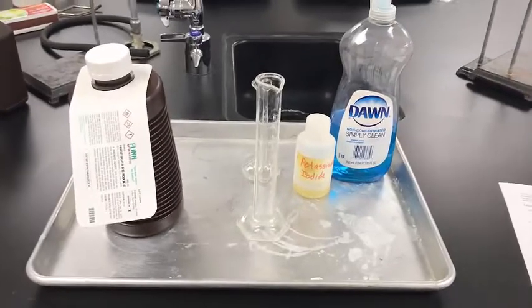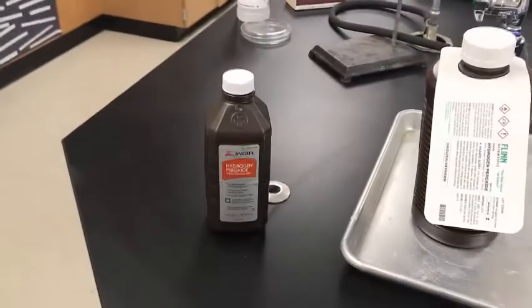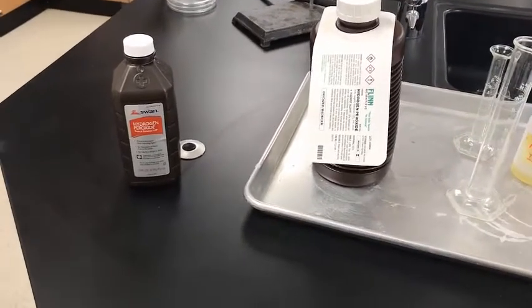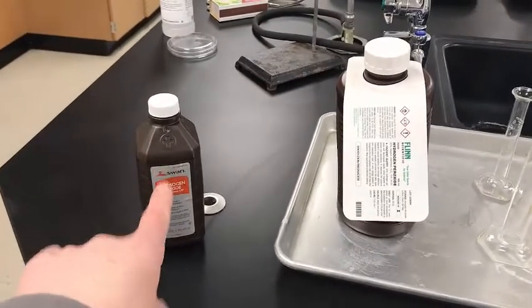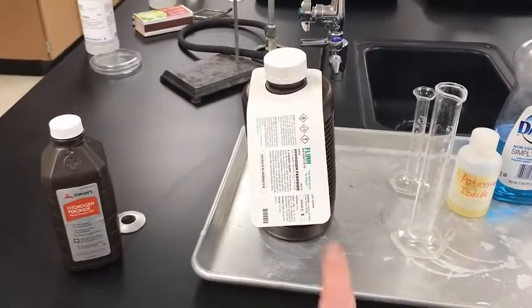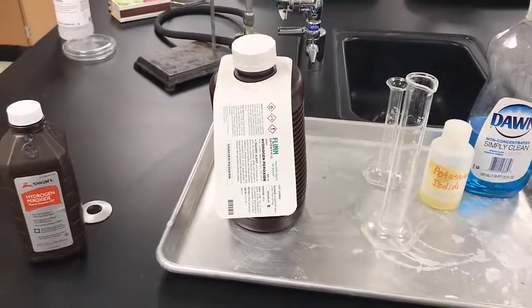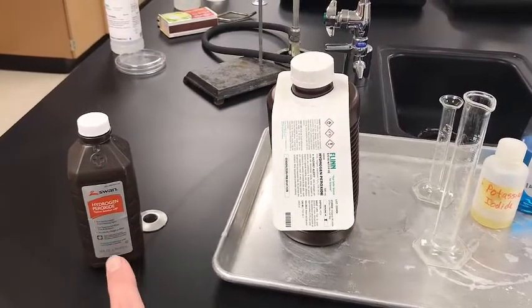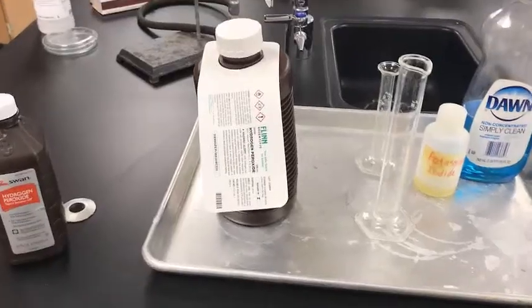You might be familiar with peroxide. You probably have some at your house. Maybe it looks like this. It's something you commonly would have in your bathroom. People use it a lot of times to treat cuts. This peroxide that you have at your house is a concentration of 3%. This peroxide that I'm going to use for today's lab has a concentration of 30%, so 10 times more concentrated. This stuff would work for the lab, but it wouldn't be as exciting. We're all about exciting in chemistry, so we're going to use the more concentrated.